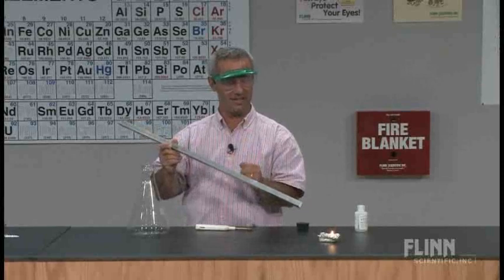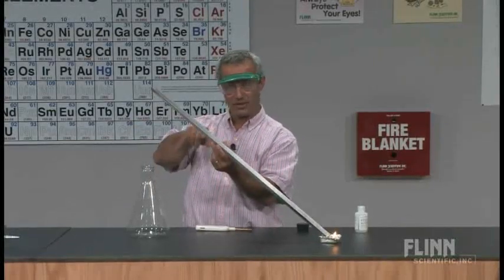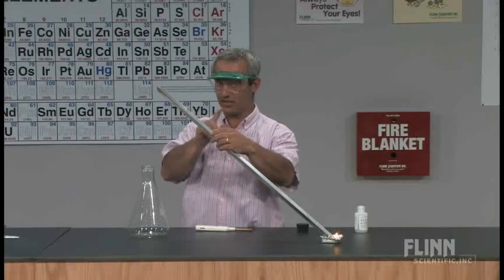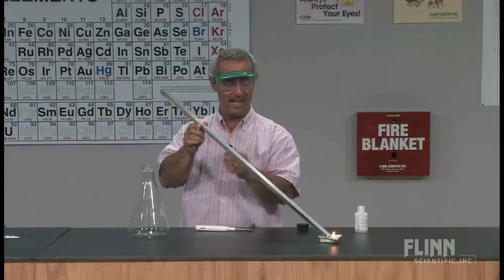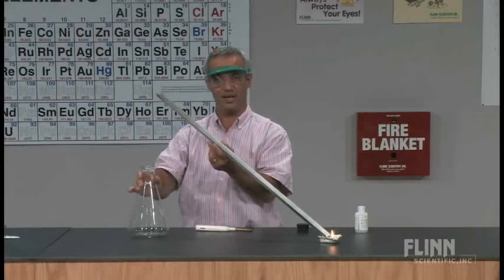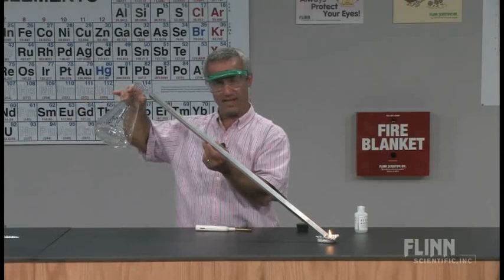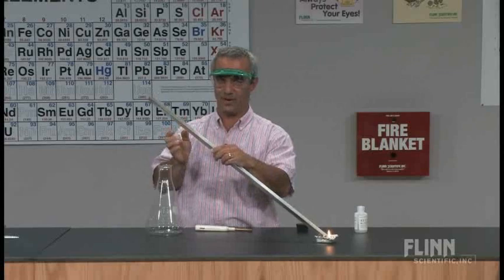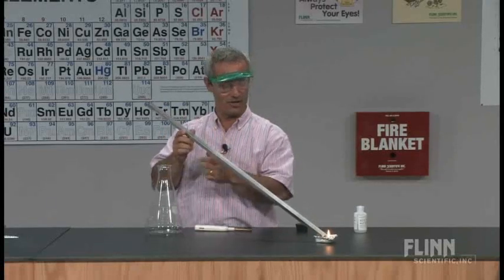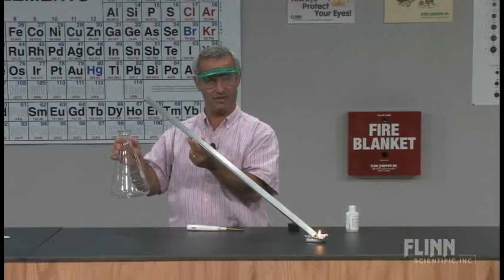Now, a couple of important tips about this. Notice that I was holding the ramp this way, not this way. Just make sure of that. Take note of that. The other thing you saw was that when the flame got back to the flask, I pulled it away. I didn't sit there with the flask still there. Well, I'm not going to show you what happens when I hold the ramp this way. Sorry. But I am going to show you what happens when I don't pull the flask away, because there's a lesson to be learned there as well.